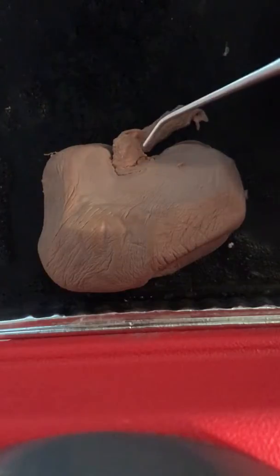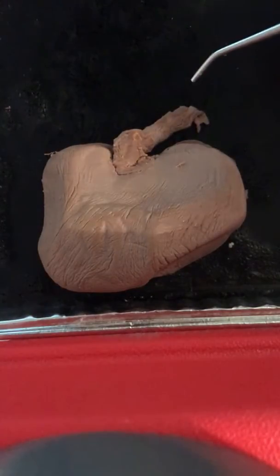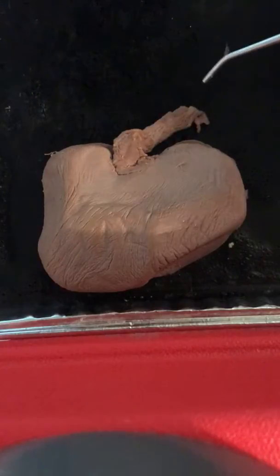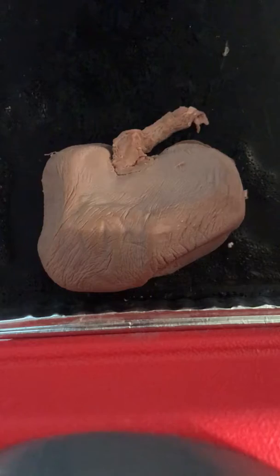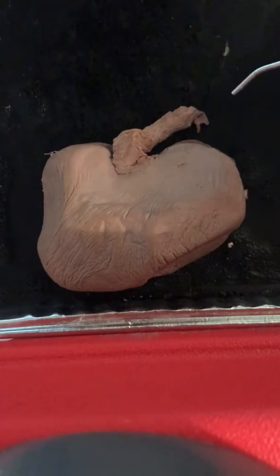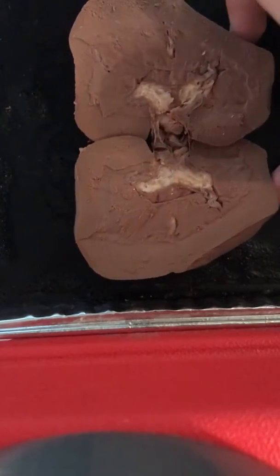The renal artery carries blood from the abdominal aorta to the kidneys, and this actually is 1/3 of the cardiac output. And then the renal vein carries the deoxygenated blood away from the kidney, so it drains the kidneys. And then we will go on to the inner surface.